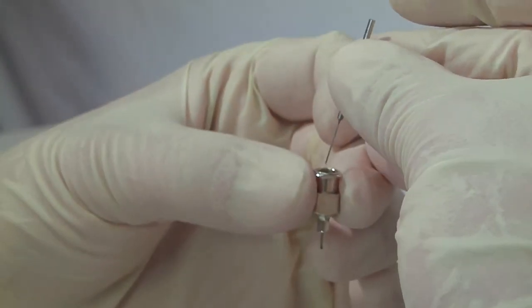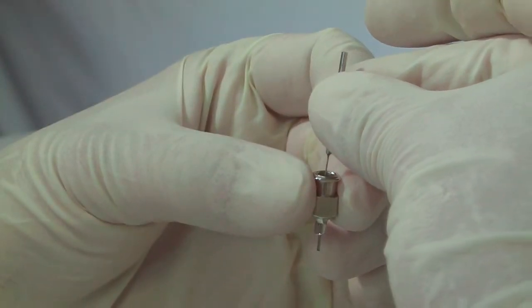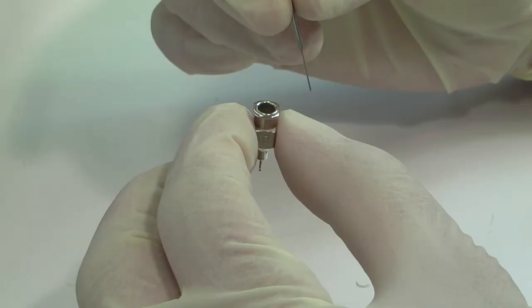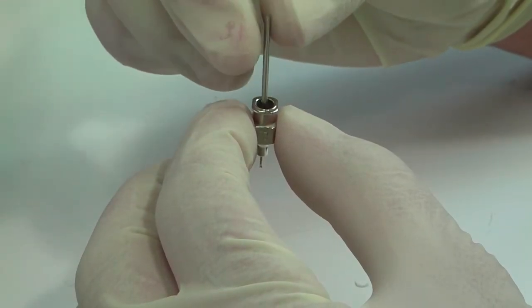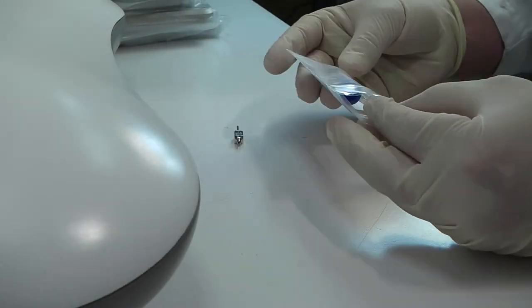To recouple a probe assembly, carefully bring the tip of the test probe as close to the bottom of the inside of the reference probe as possible, then gently drop the test probe straight down. Be sure to let go of the test probe before it touches the bottom of the reference probe to prevent blunting the tip of the test probe.